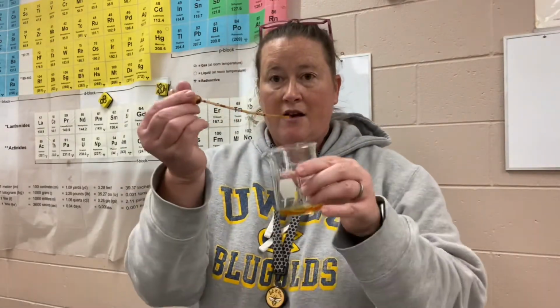We will be using specific equipment for titration, a burette stand, Erlenmeyer flasks. We will not be using squirters and test tubes like I'm doing in this demonstration here, but we'll be using specific equipment that I'm going to share as well in the video.